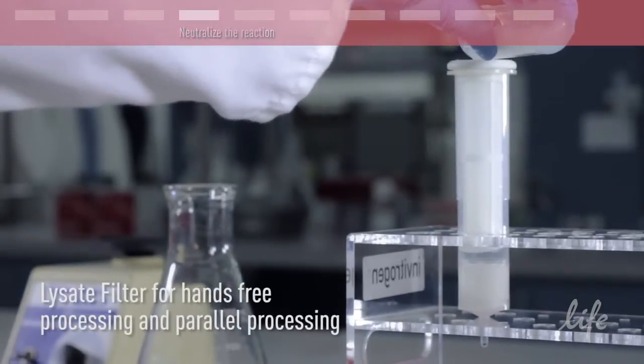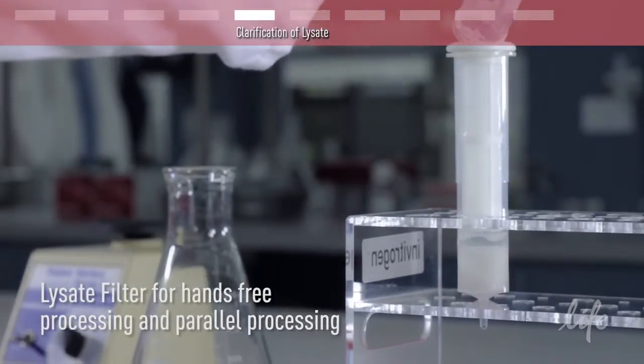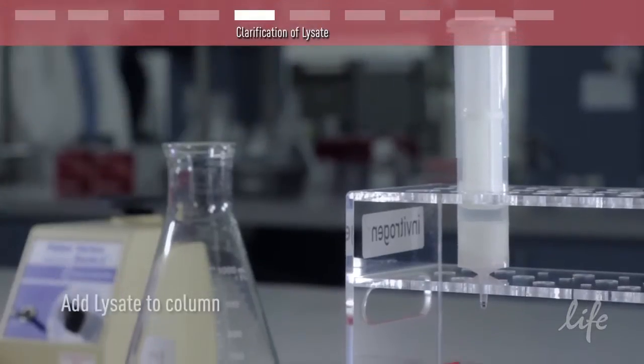The use of the lysate filter provided with this kit means there is no need for additional centrifugation steps here.